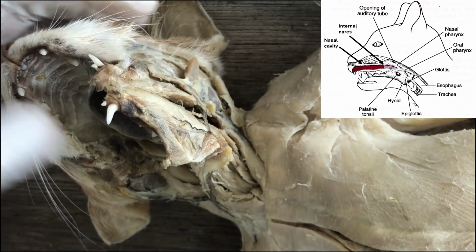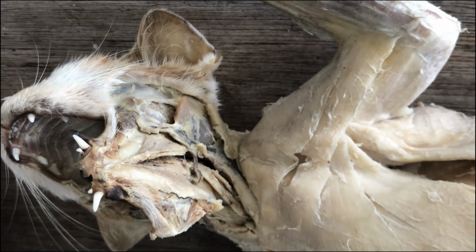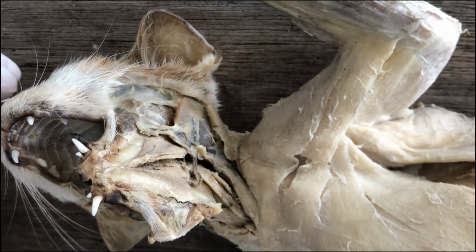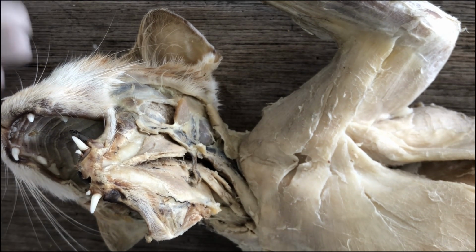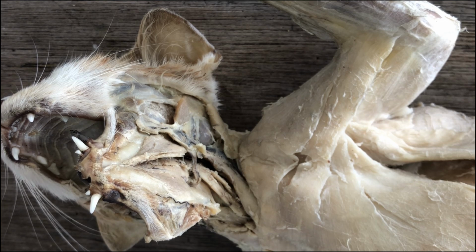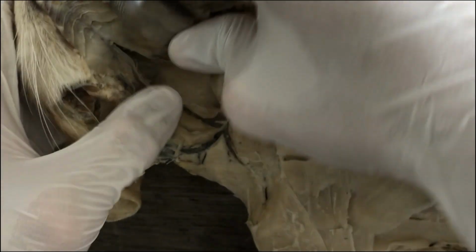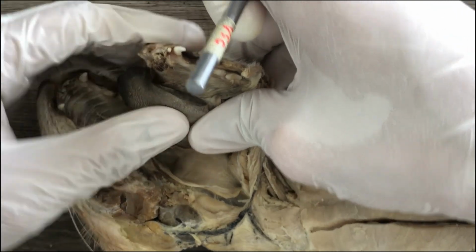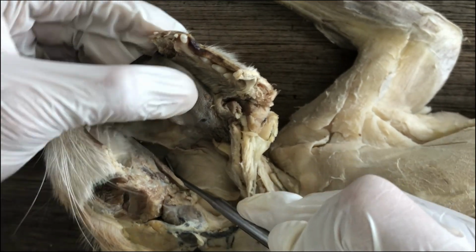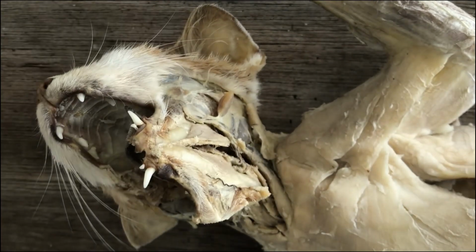inside the nasopharynx. But suffice it to know that those slits are the openings to the auditory tube or eustachian tube, which links the middle ear cavity to the nasopharyngeal cavity. And it serves to equalize the pressure inside your middle ear. So that's the functional relevance of the auditory tube opening. So if you want to see it, just look for it during our face-to-face lab activity. But that's one slit there that really doesn't want to show on camera. Okay, it's a bit dark.